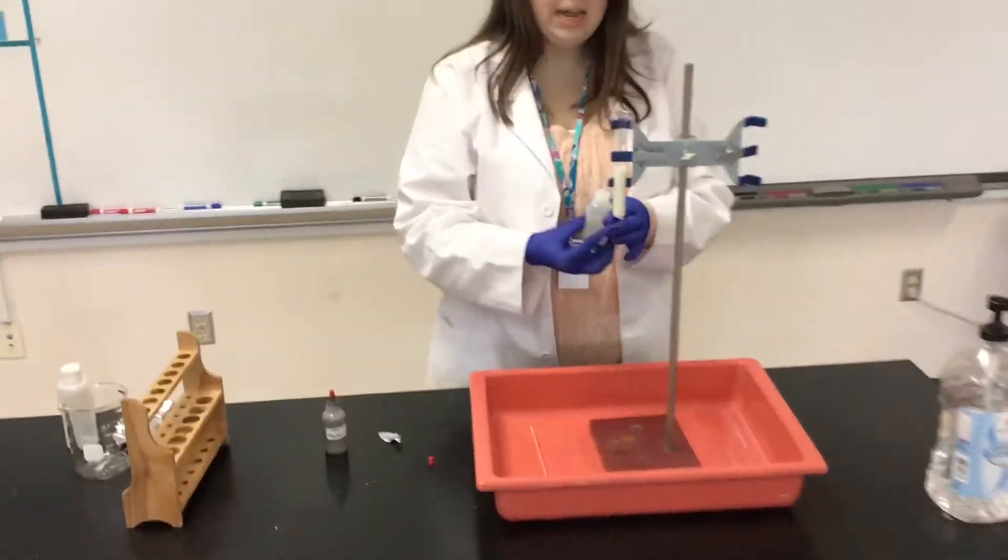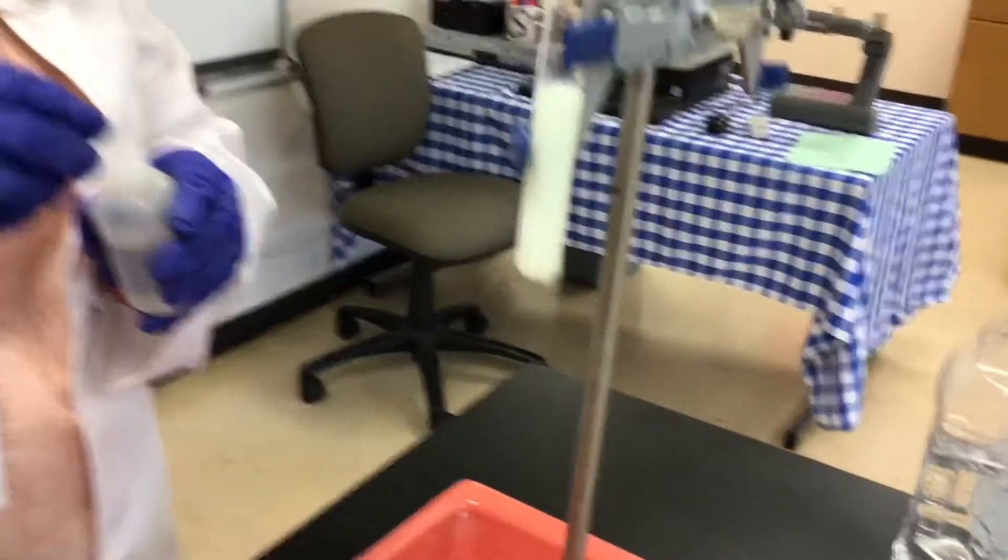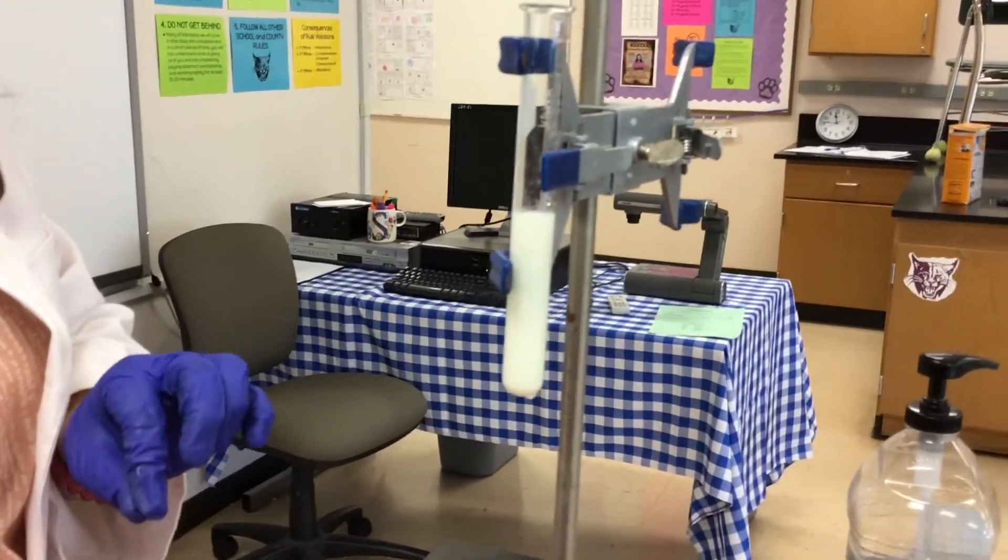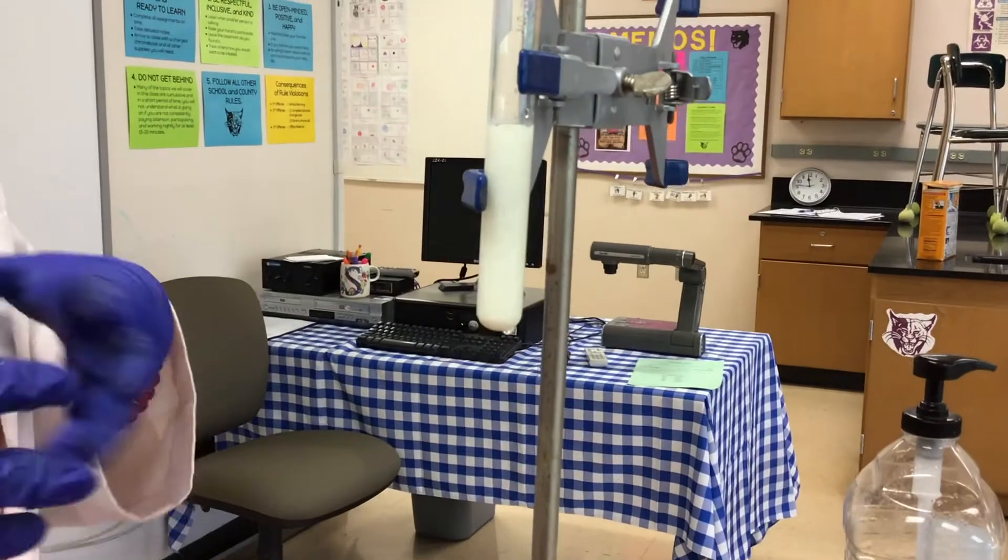What we're going to see happen is this milky-like solution is going to form. If we watch it for a few minutes and look really closely, you'll start to see some solid particles forming.